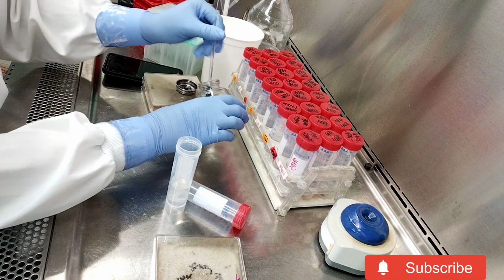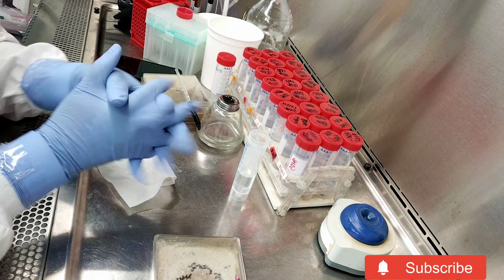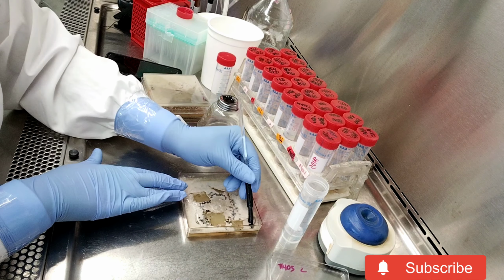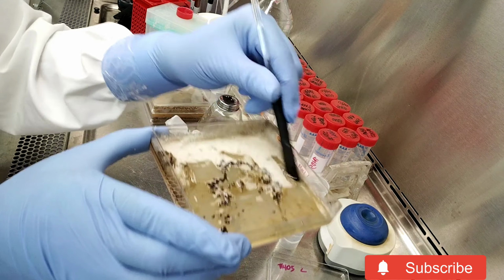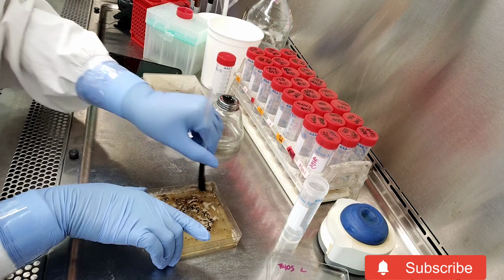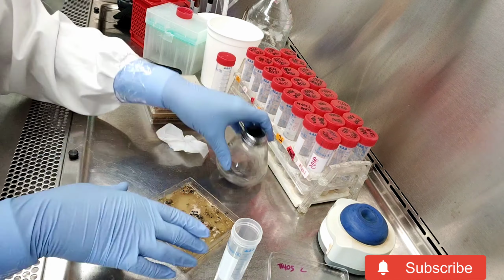So here I am carrying out the spore harvesting. I sterilize that little device, that little glass rod with the black thing at the end. It's called a policeman. I pour water and I use the rod to dislodge the spores. So you can see the white mycelium is coming off. Those hard structures are sclerotia, and the pathogen uses them to survive during unfavorable conditions.